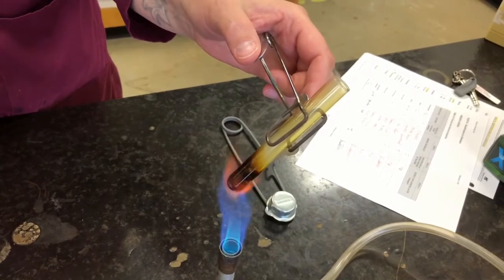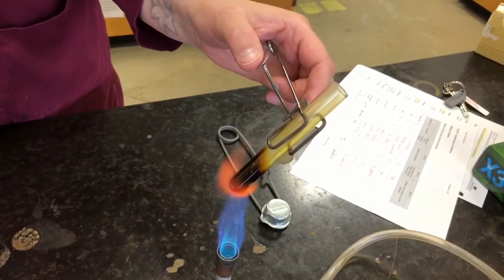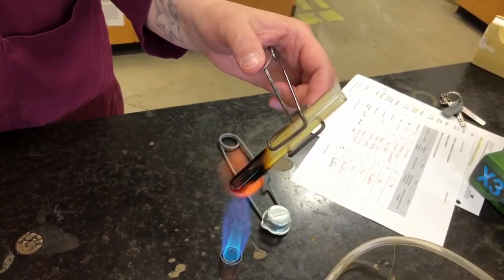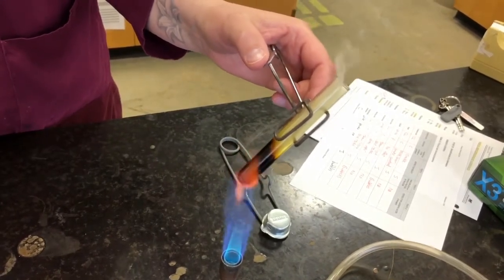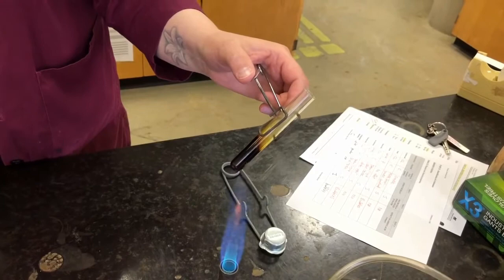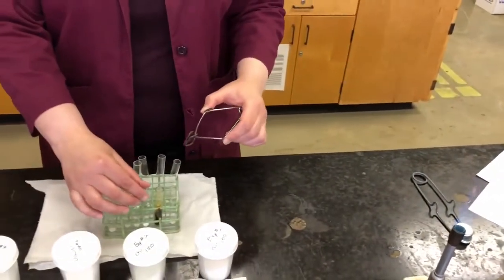It's turning brown, almost black. It's giving off a brownish color vapor, and that will continue until all of the sugar is completely melted. So it melts, it turns brown, it gives off smoke, and that smoke actually has a sweet smell. It's kind of like the smell of roasting marshmallows over a campfire, which is the smell of burning sugar, of course. There we go, so that's our sugar. Put this one down and let it cool.